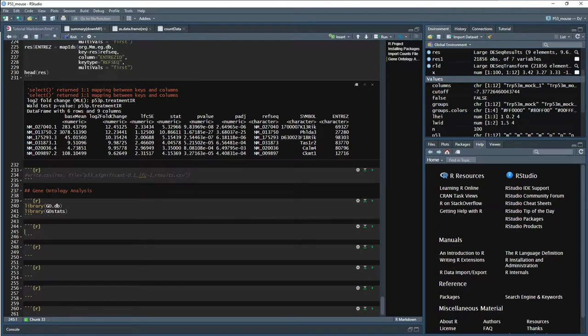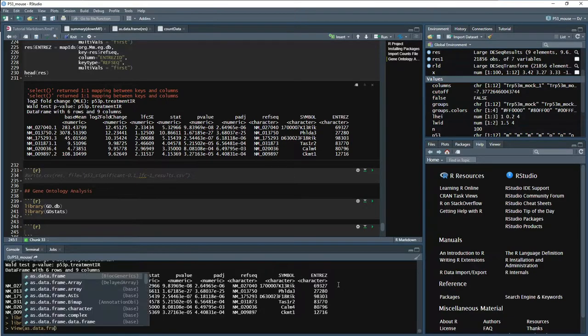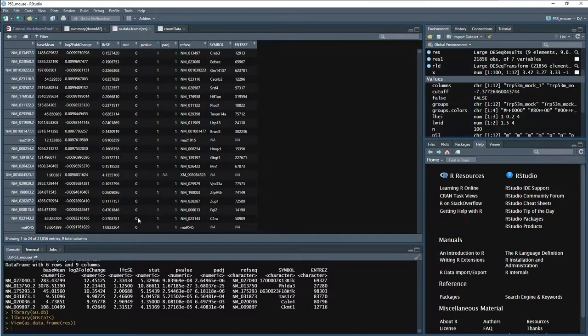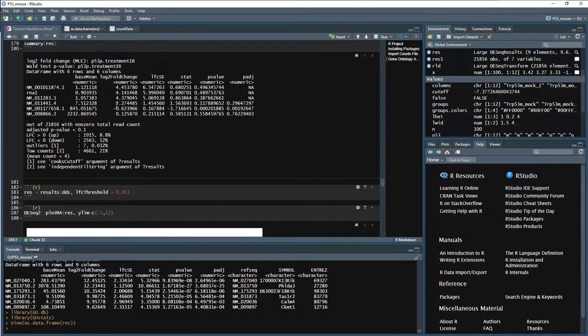The next part that we have to do is subset our table that we have above. So here we have our calculated significance of our particular genes that we had mapped from our feature counts. But if we do something like view as data frame, and we want to look at our res table, we can open that up, and we can click p-value, and we can see some of them are really significant. But if we go the other way, it doesn't actually subset based on that adjusted p-value that we input for DESeq2. What we input to DESeq2, when it gives an output, it's just telling us how many are up and down regulated with a log fold change greater than whatever we input.